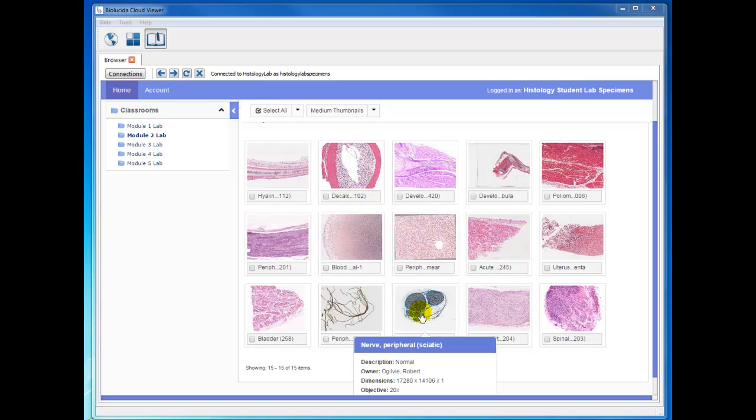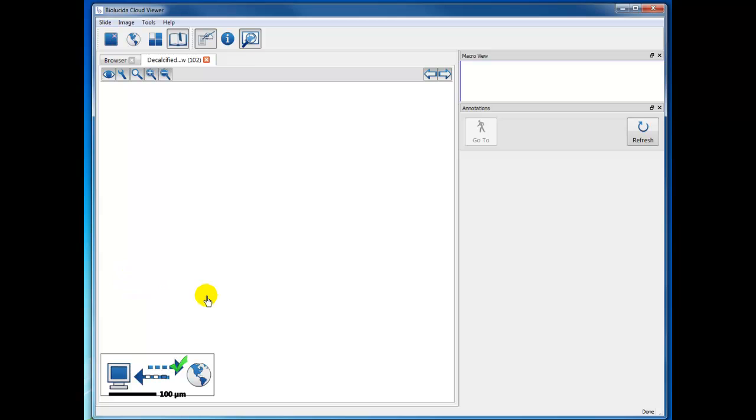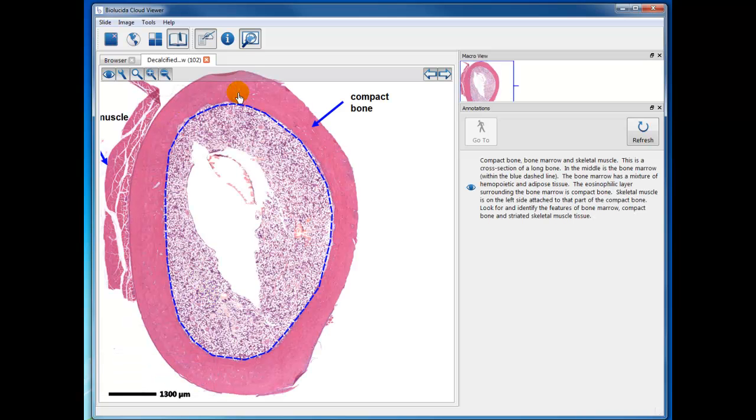This video will review the second specimen. Here it's decalcified bone. And so when we open this specimen, you see a very eosinophilic staining ring. And in that, you see a mixture of lightly stained areas and non-stained and some basophilic and eosinophilic areas. But in the center here, you have empty space. This is an artifact, an artificial fact. It is a result of the tear of the tissue.